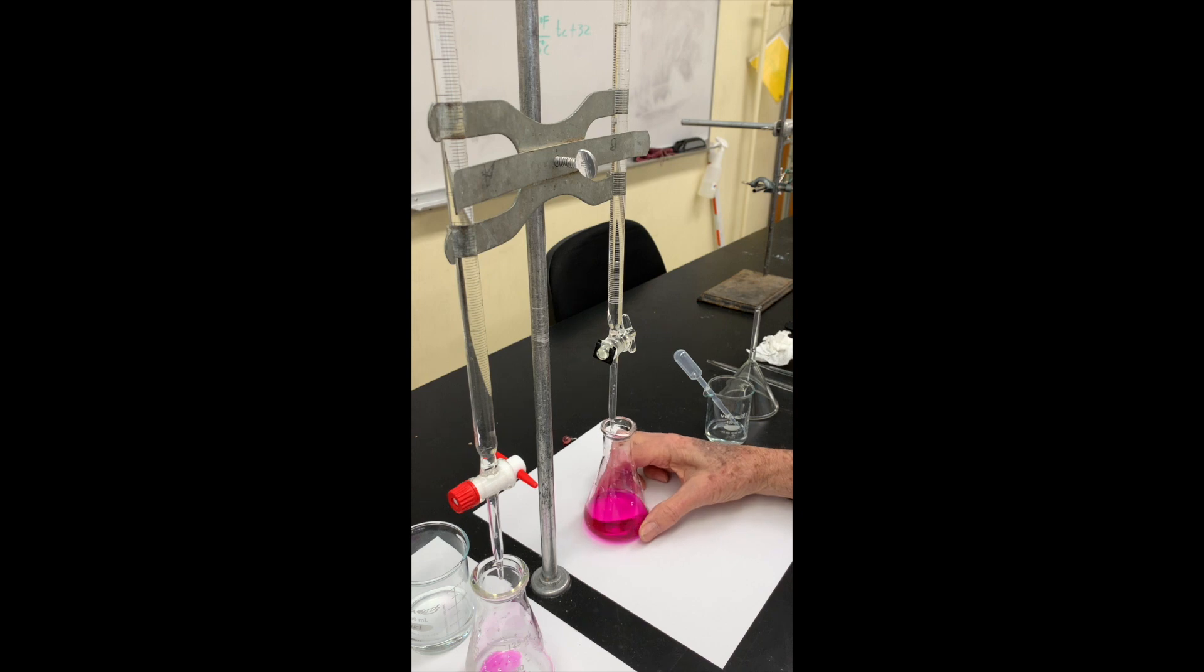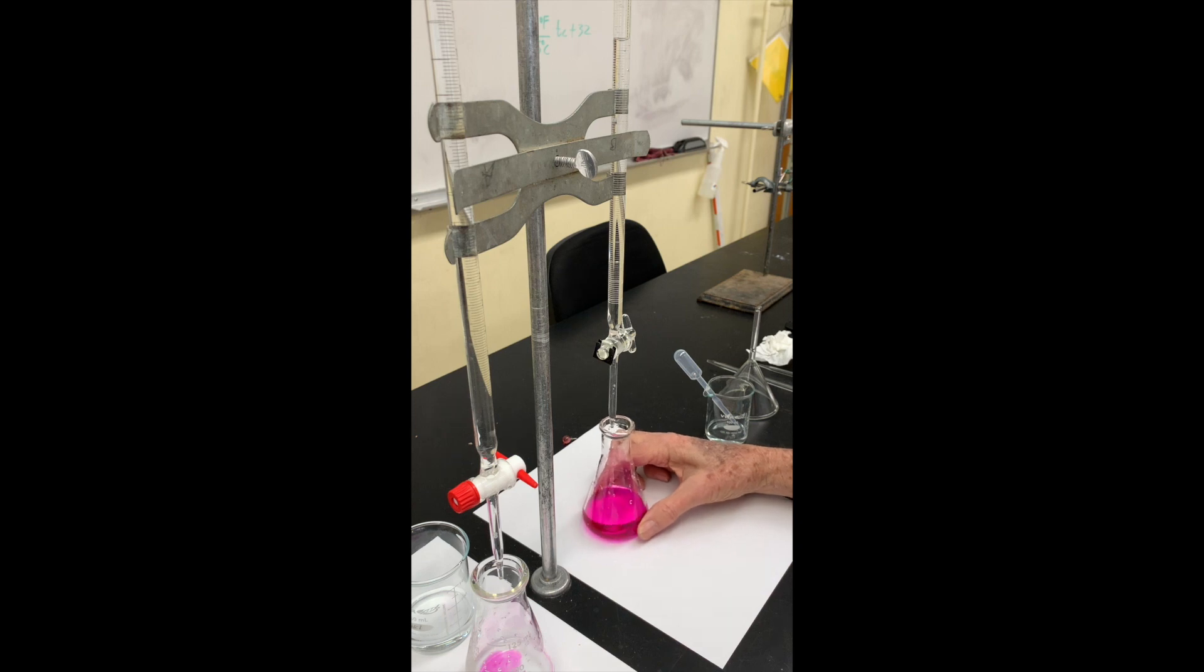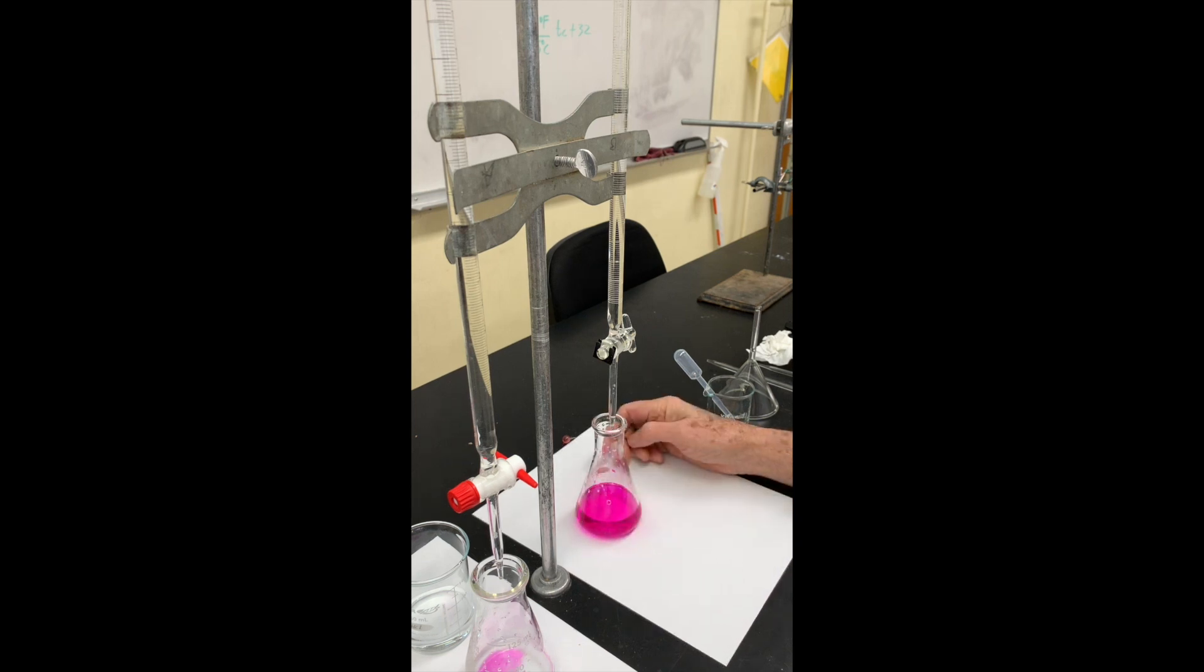You add the titration material gently. You don't want to overrun the titration because it's difficult to back up. When you get close, you'll want that left hand out of the way.